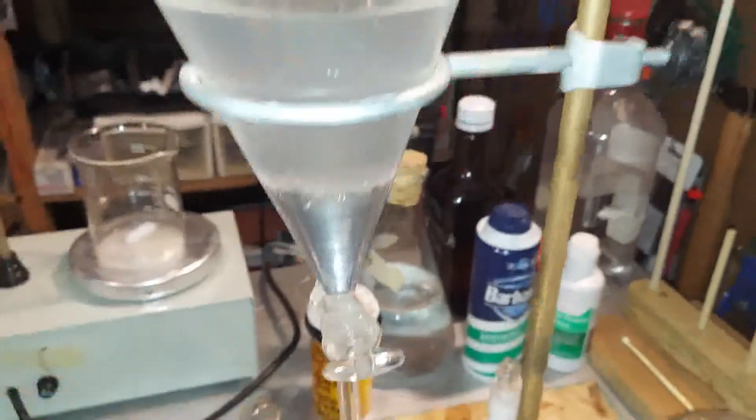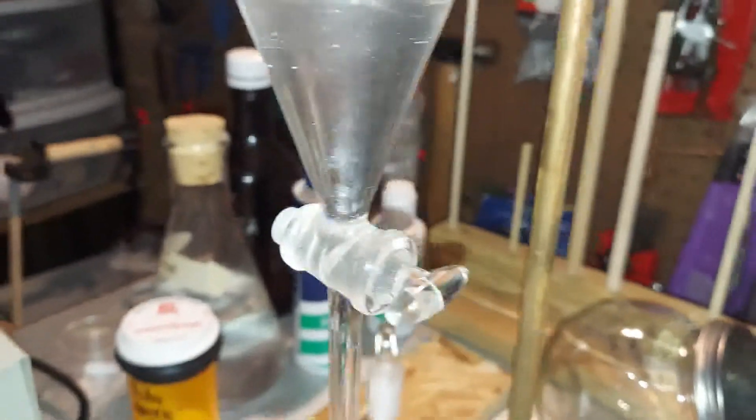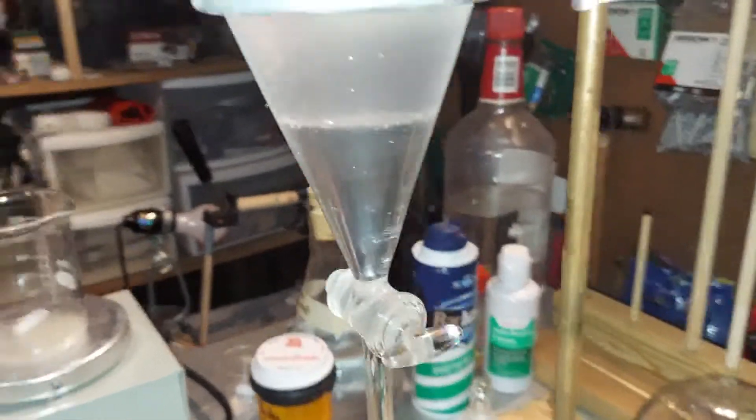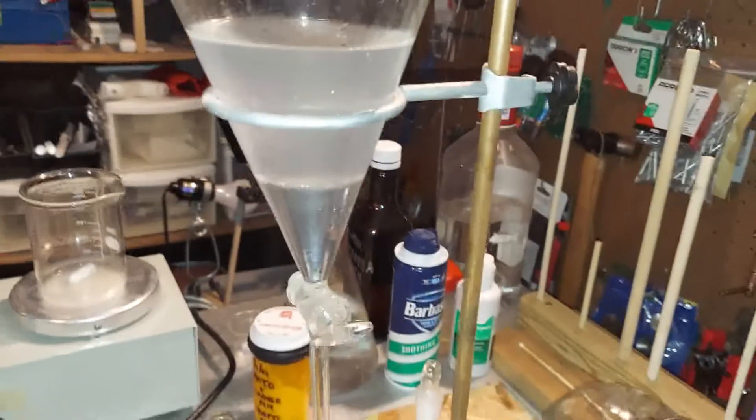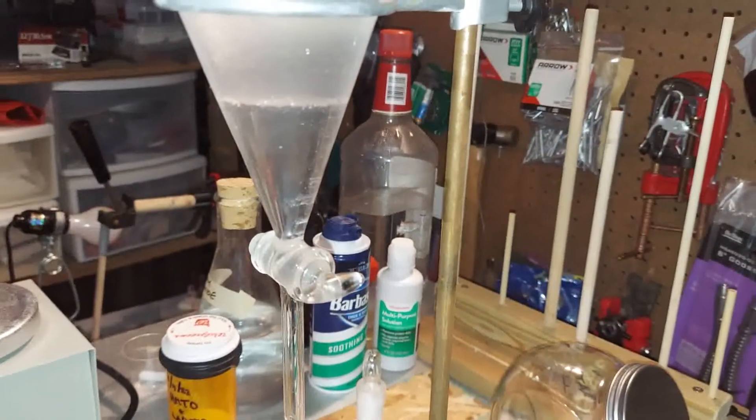And you'll notice something right away - that it cleared up as the salt took out water which was mixed in there. I'm going to shake it up good now, and then we'll take out the bottom and that will be distilled to purify it. That's the next step.